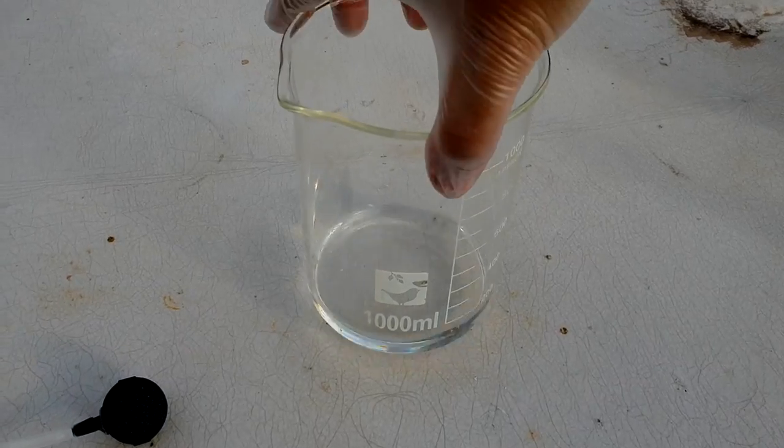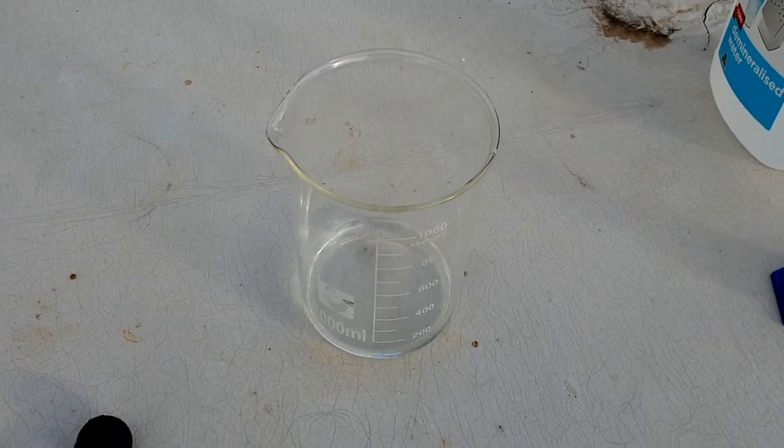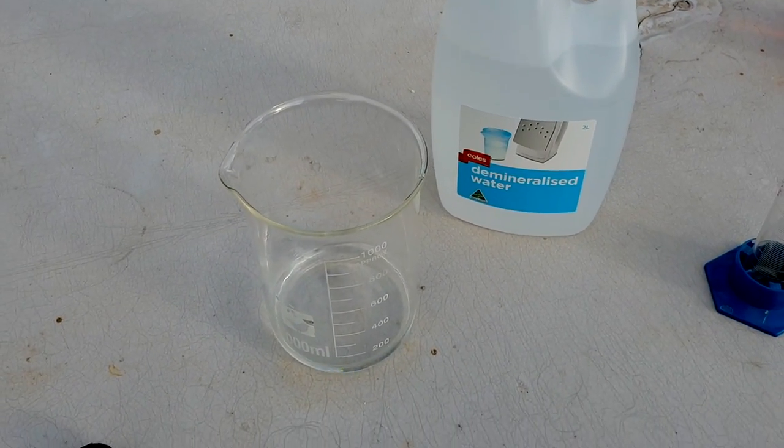All right. So, this here is 100ml of nice, pure ammonia solution that I just made. And, I'm going to add a little bit more distilled water to it, just to bump up the volume without dropping the ammonia content.